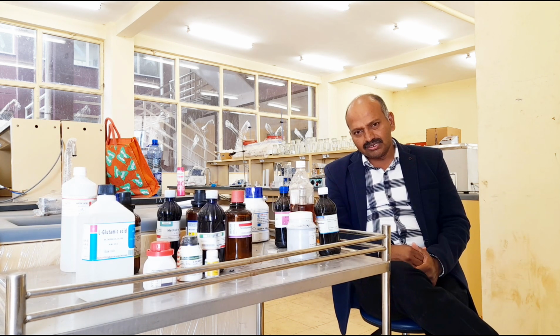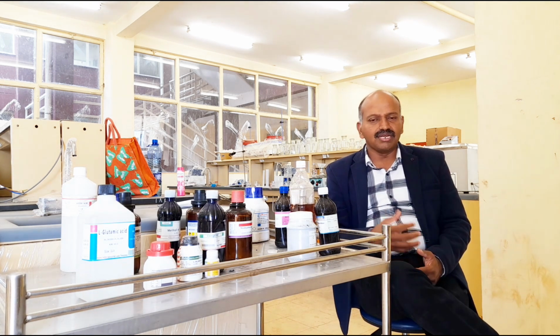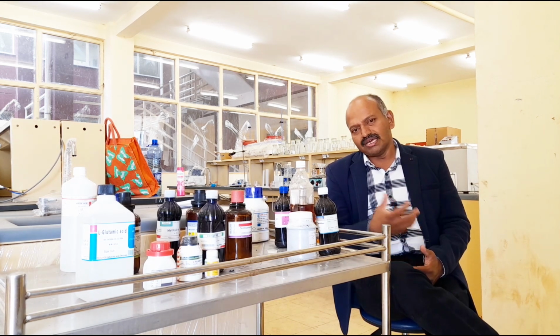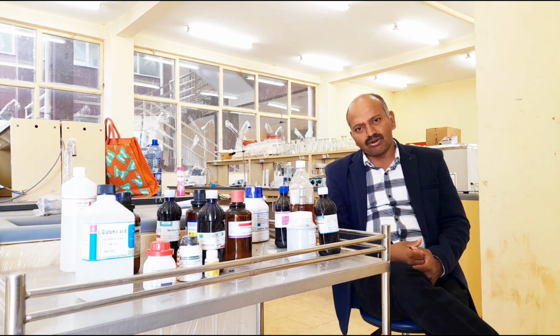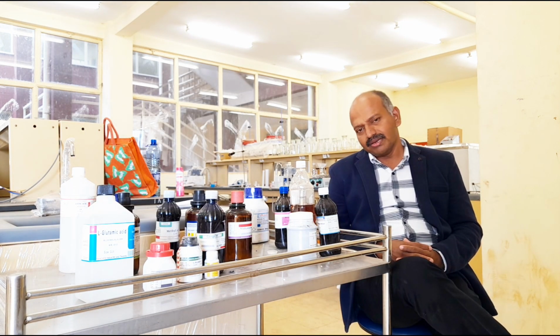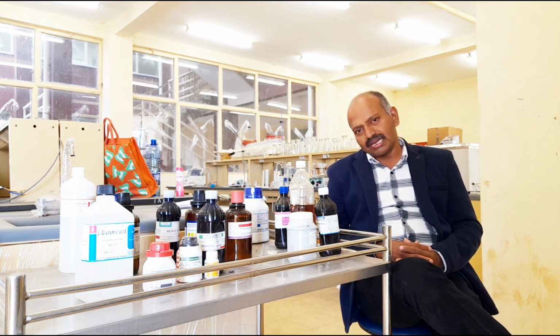After complete dilution, from that 100 ml volumetric flask containing the diluted wine sample, we have to take 25 ml of the sample into the conical flask, and already fill the burette with the 0.1 molar sodium hydroxide solution. Now we add 2 drops of phenolphthalein indicator to the 25 ml wine sample. There is no change in color because phenolphthalein doesn't produce any color in acidic medium. Then we have to titrate the wine sample containing citric acid with the sodium hydroxide from the burette.